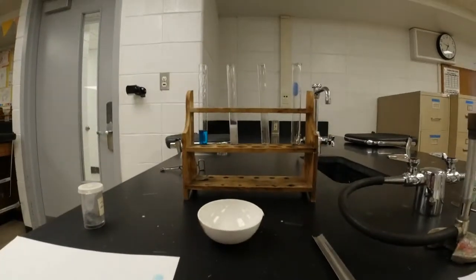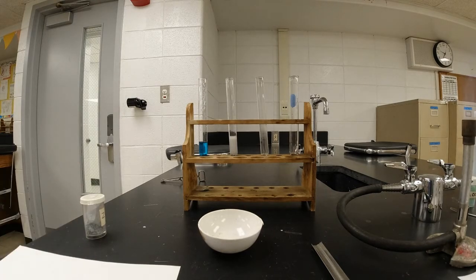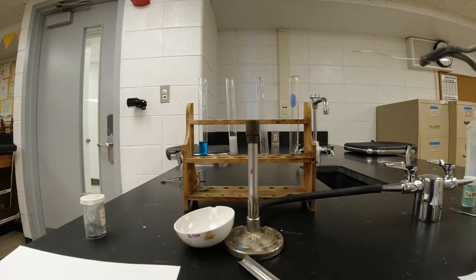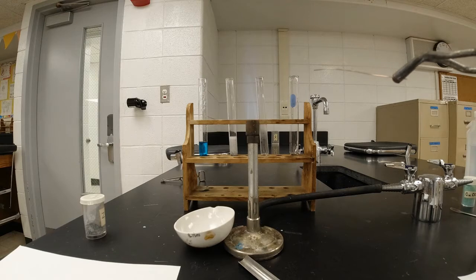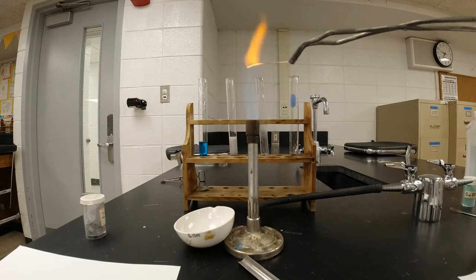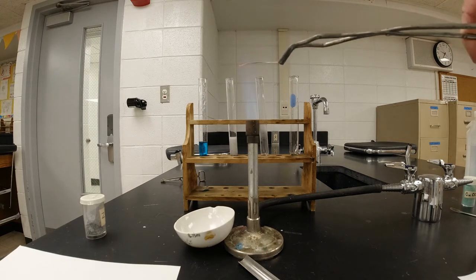Now, I don't know if you guys can see the copper wire plain enough, but the copper, it's coppery, kind of that reddish orange color, like a brand new penny would be, if you guys know what pennies are. And what I'm going to do is put it in the crucible tongs like this, and I'm going to heat it in the Bunsen burner flame. All right, so I put it in there, and it's almost immediately starting to turn bright red. If I hold it in there long enough, it'll actually start to melt.